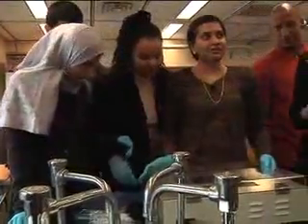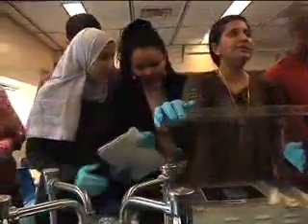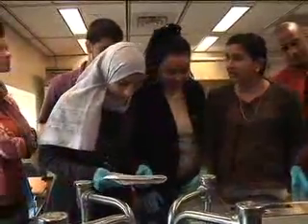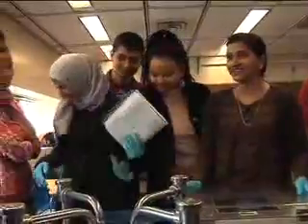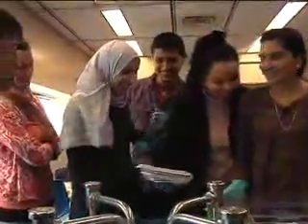Wait, what happened? So who's going to go on the witness? You lost your DNA, madam. You have no DNA. What the students are doing here is they're trying to profile their DNA.